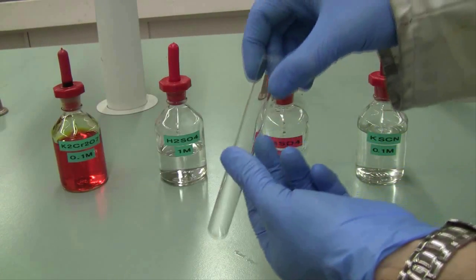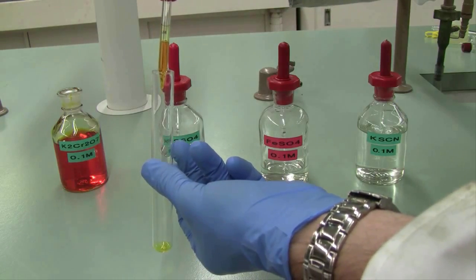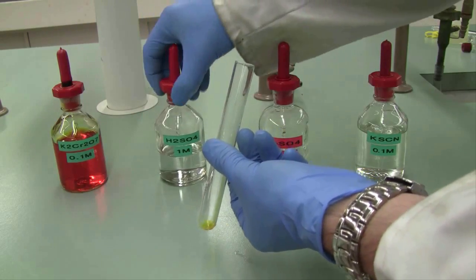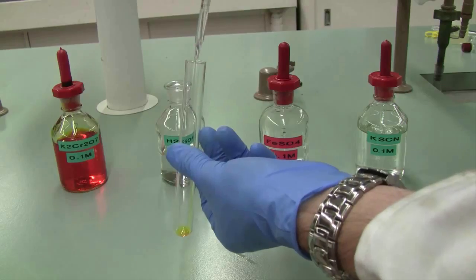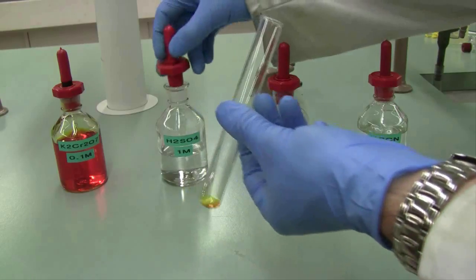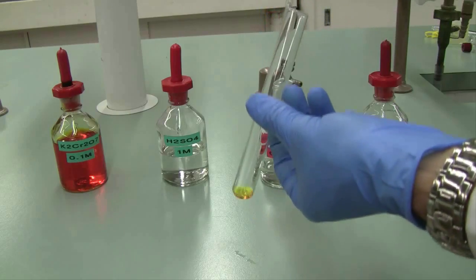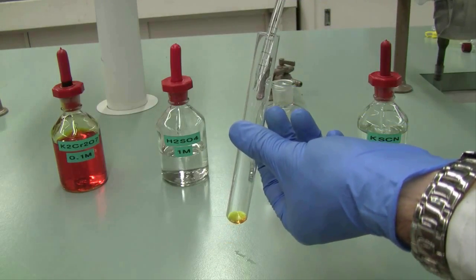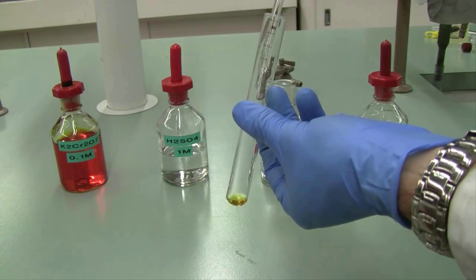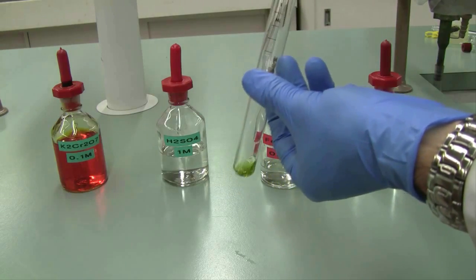Moving on to the final part of your experiment, looking at some redox reactions, I'm going to start with the example system from your experiment. We're going to add some potassium dichromate to a test tube, then going to add some sulfuric acid, and then going to add some iron sulfate, drop by drop, and watch what happens. As we add, you can see the solution go from the orangey yellowy colour through to a light green.